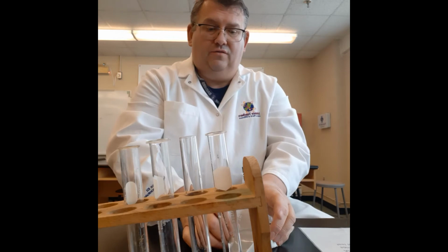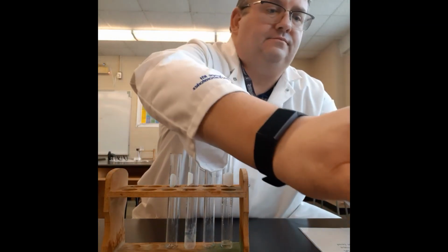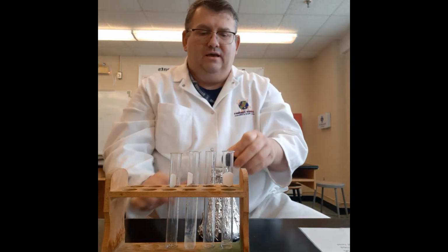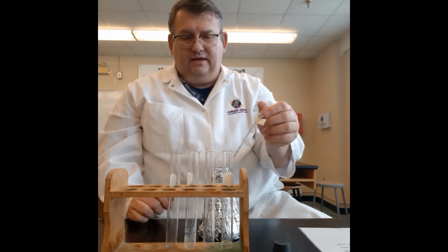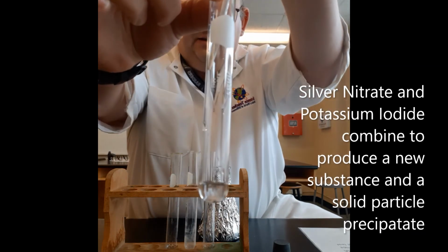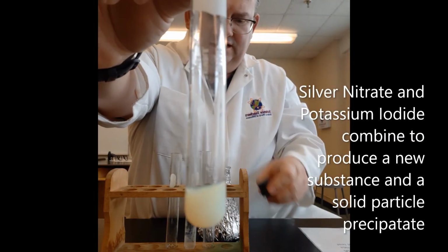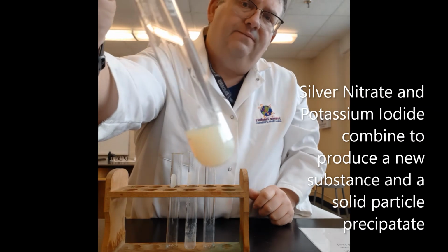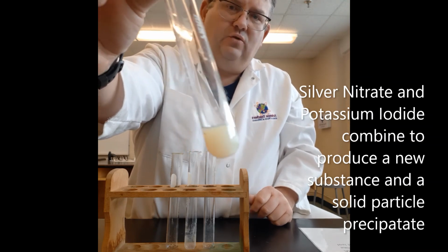I'm going to move this back out of the way because we don't want to cross-contaminate the silver nitrate with the potassium. In here, I have silver nitrate, which is AgNO3, and the potassium iodide is KI. I'm going to take this now and fill the pipette with silver nitrate and add that in, and you can see what happens. Instantaneous reaction there. When we place about the same amount in, you actually see something occurring. You need to use that information to answer the question on your sheet for station 4.